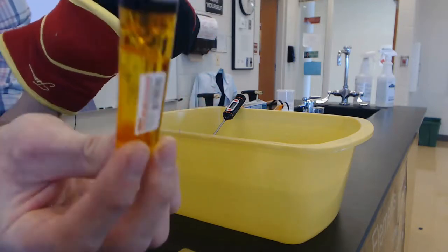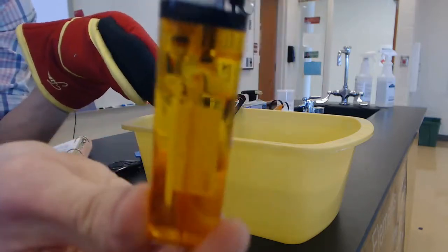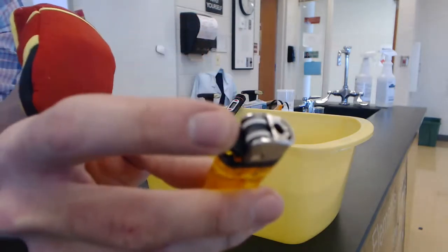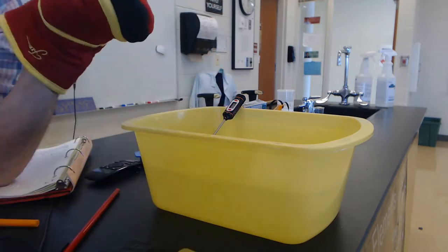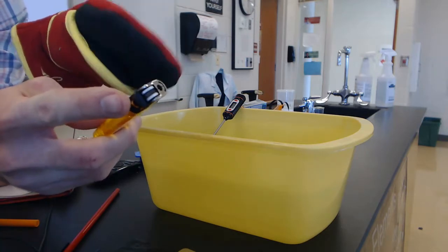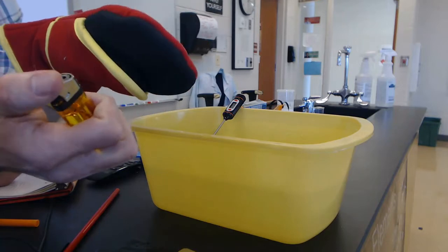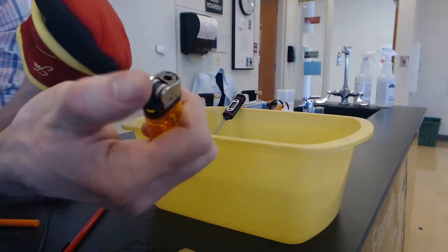We're going to use the ideal gas law to solve for the molar mass of butane. Butane is in lighters like this — you can see the liquid in there. The liquid is butane, but you can easily make it a gas if you hit the little lever on the lighter. If I click the lever, I can hear and feel the gas come out. Butane evaporates very easily. Basically how lighters work is you have the sparks plus oxygen in the air plus the gas, and together you get the flame.